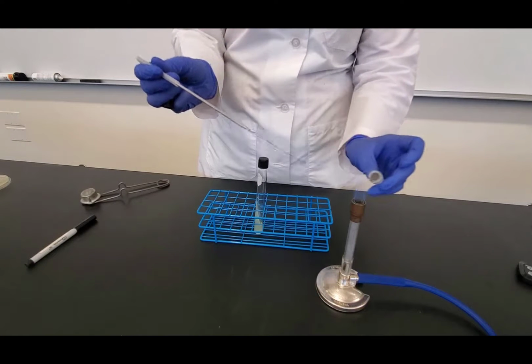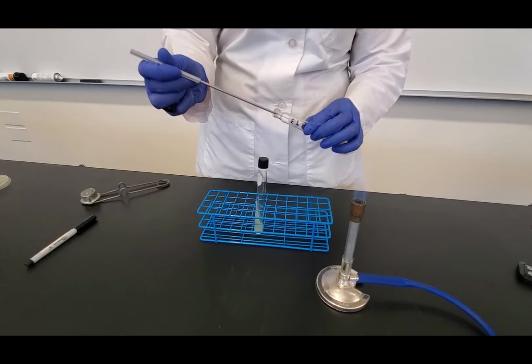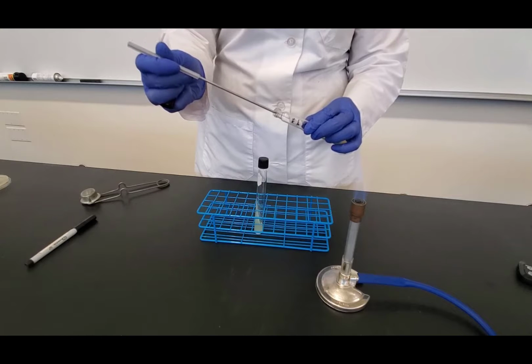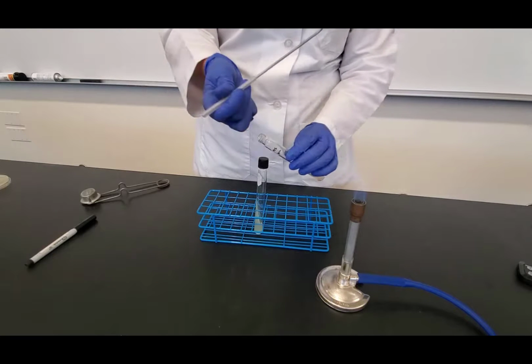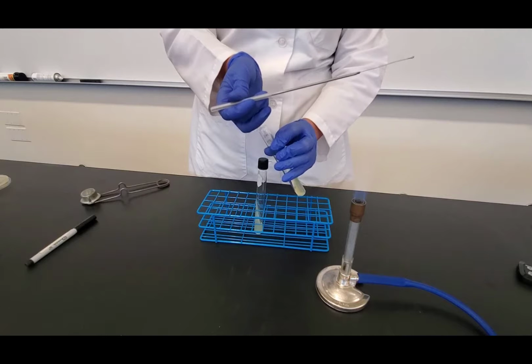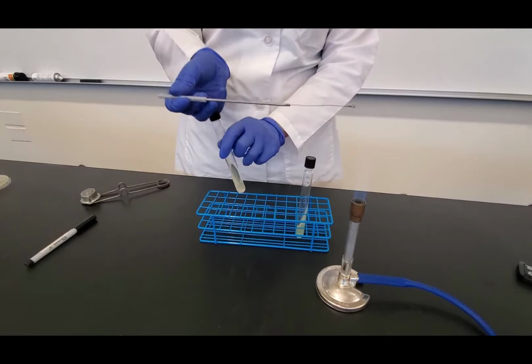I'm going to pass it through the flame, and then holding the tube at an angle, I bring the tube up to my loop, and my loop is going to touch where the bacteria is growing. And so it's picking up some of the bacteria, and I'm going to very steadily take my loop out, flame the opening of the tube, and put the cap back on. So now on my loop, I have my bacteria. I want to keep my loop hand steady. I need to inoculate the sterile tube.